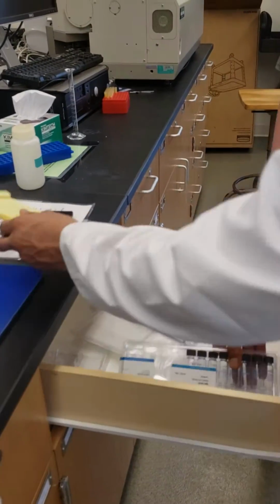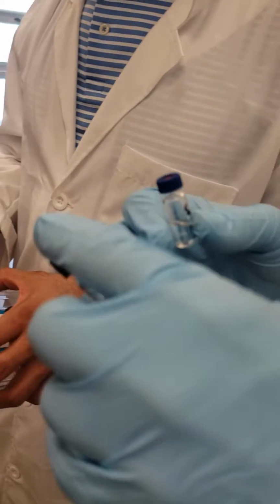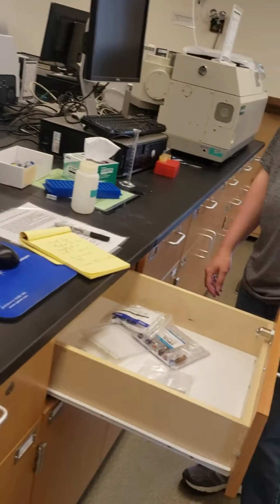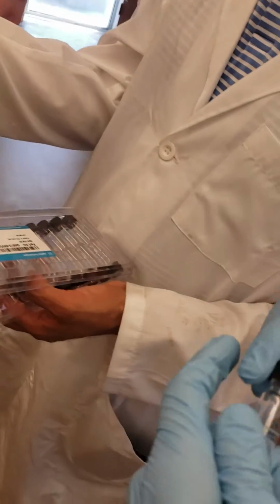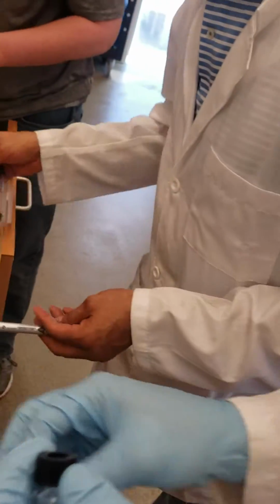Okay. Let's fill this one with dichloromethane because we need those for the washing. We will not use that one. This is too small. How much? Half? Up to the level at least, or a little bit higher. It could be okay. Maybe it's rubber or plastic? What is the cap?